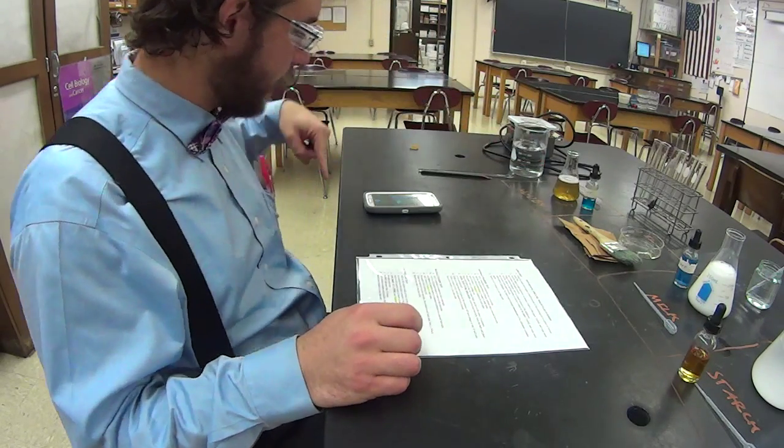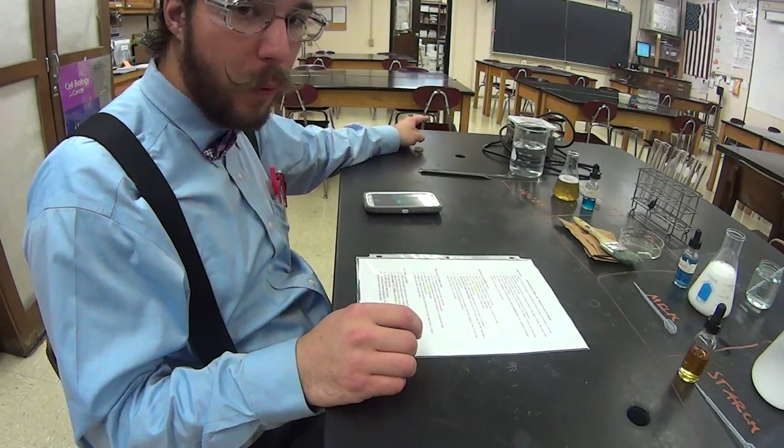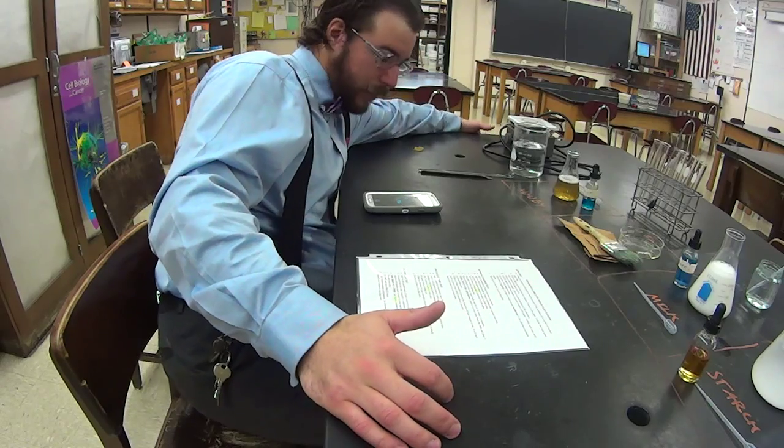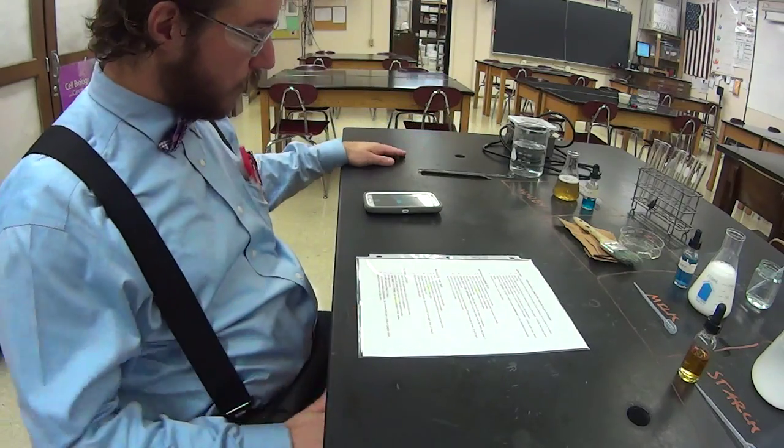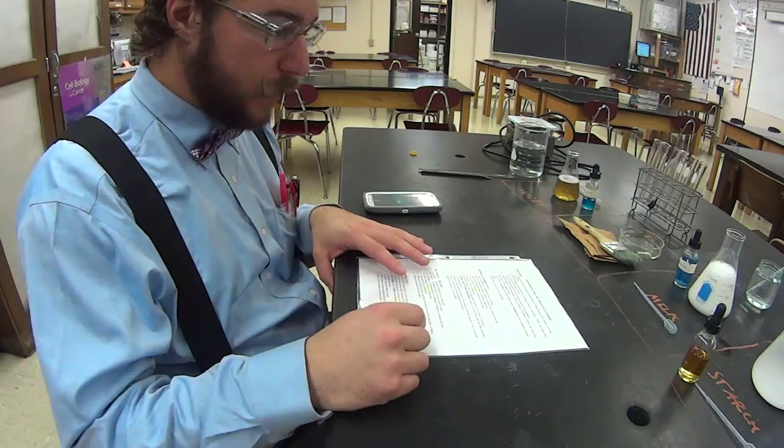You're going to have to plug the hot plate in. Before that, you need to make sure you have the table plugged into the wall. There's these little flippy power thingies over here on the side, an extension cord inside. I'll show you how to do that. This table, by the way, gets plugged in right over there.